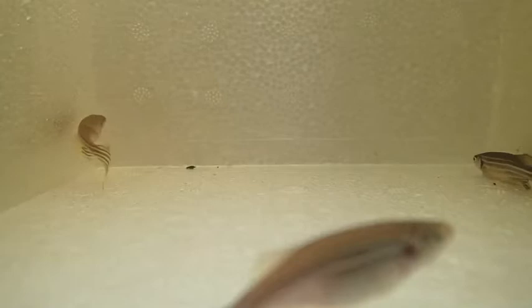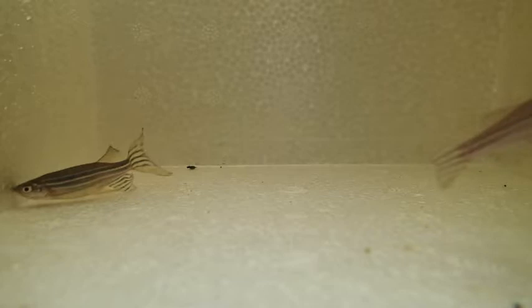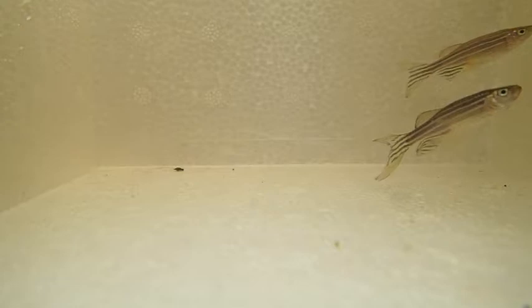You'll also notice that as fish become anesthetized, they lose their ability to maintain their level in the water column and they'll sink to the floor.